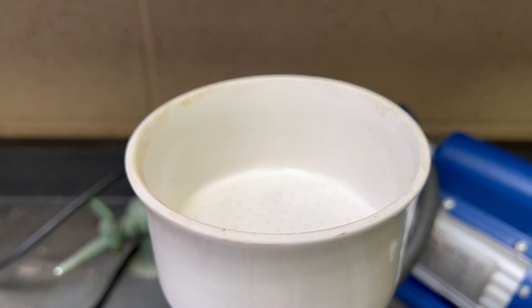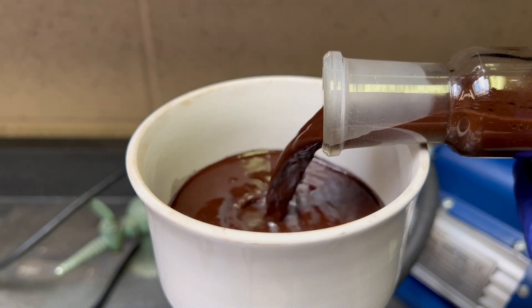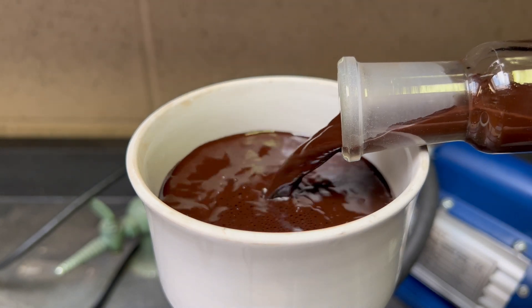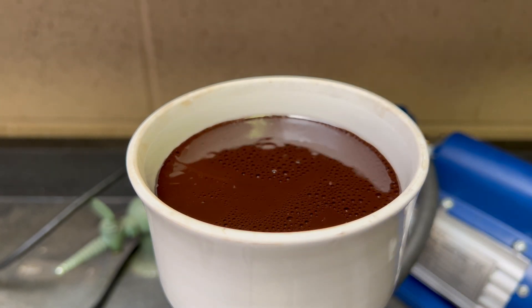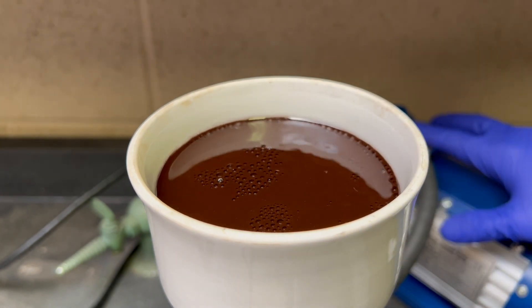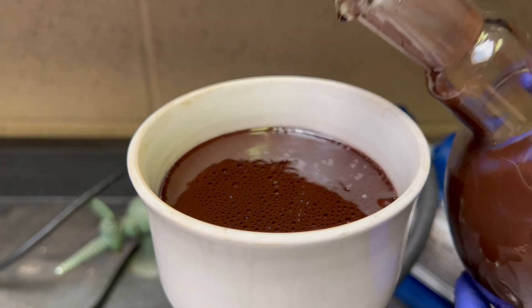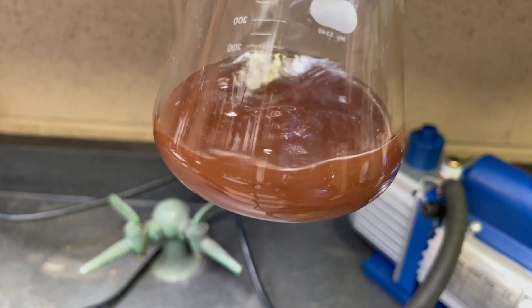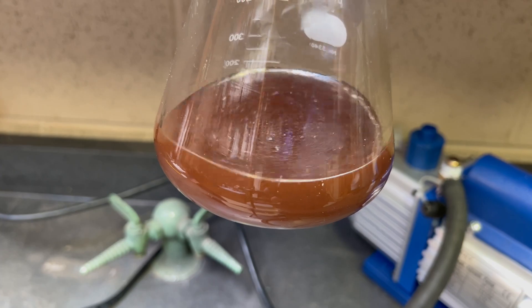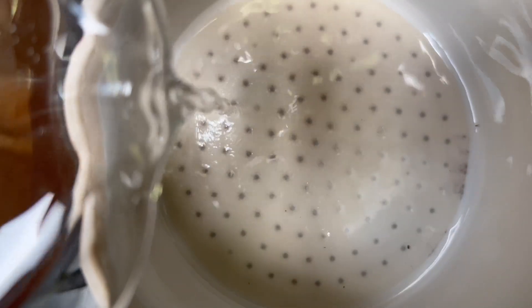The solution is then filtered. Potassium benzoate is very soluble in water. The filter paper will capture the manganese dioxide and let through the soluble benzoate. The manganese dioxide is then rinsed with water a few times. In some cases, some manganese dioxide would pass through the filter and make it into the collection vessel. In that case, I would just run it back through a filter.